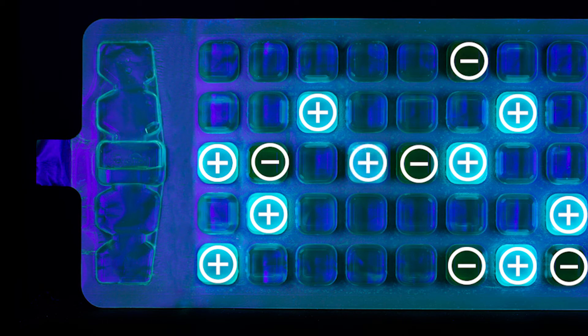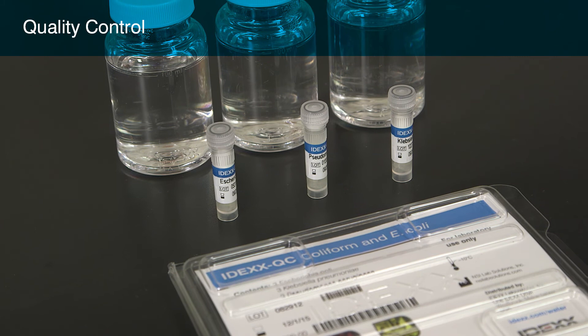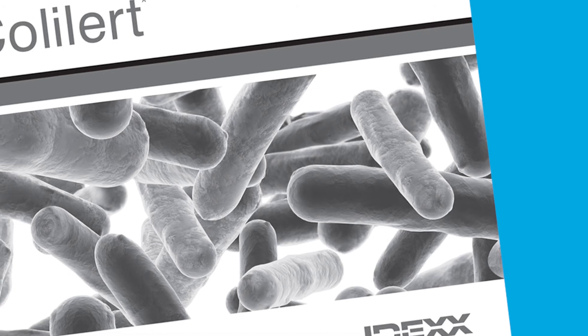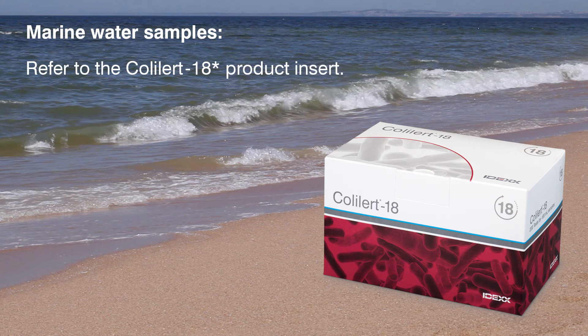IDEXX recommends that you run a quality control procedure for each lot of ColiLert tests. You will find the quality control procedure in the ColiLert product insert. For marine water samples IDEXX recommends using the IDEXX ColiLert 18 test. Refer to the ColiLert 18 product insert for more information.